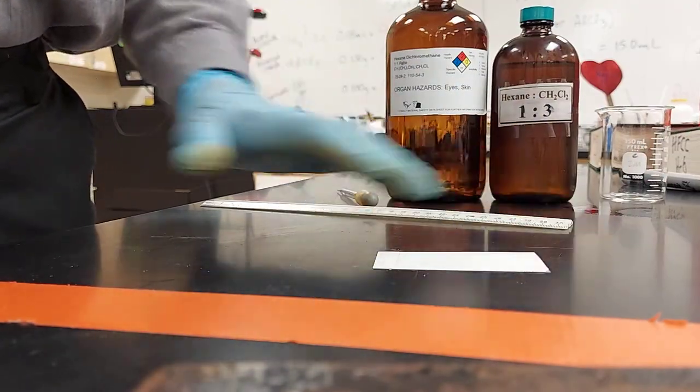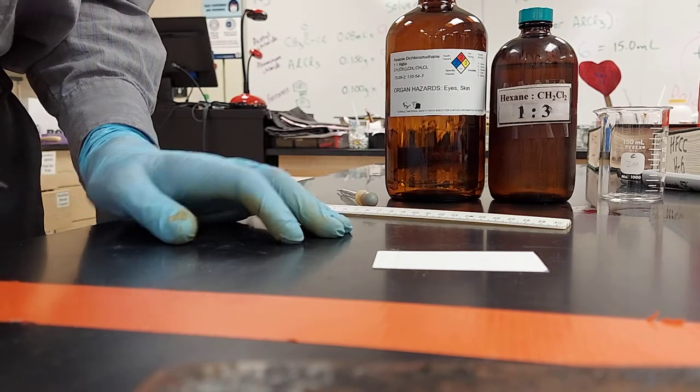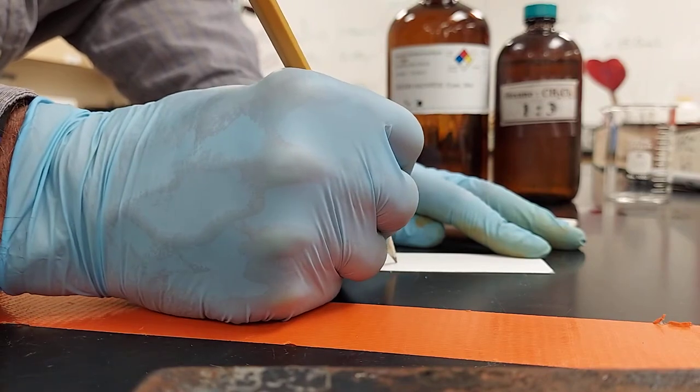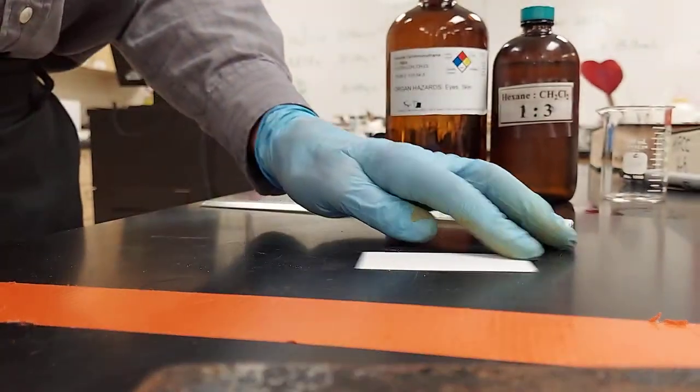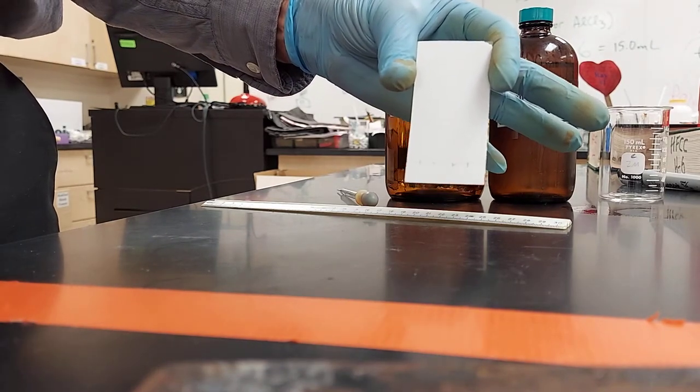You're going to need four guide marks, evenly spaced, not too close to the edges. One, two, three, four. Four guide marks, evenly spaced, not too close to the edges.